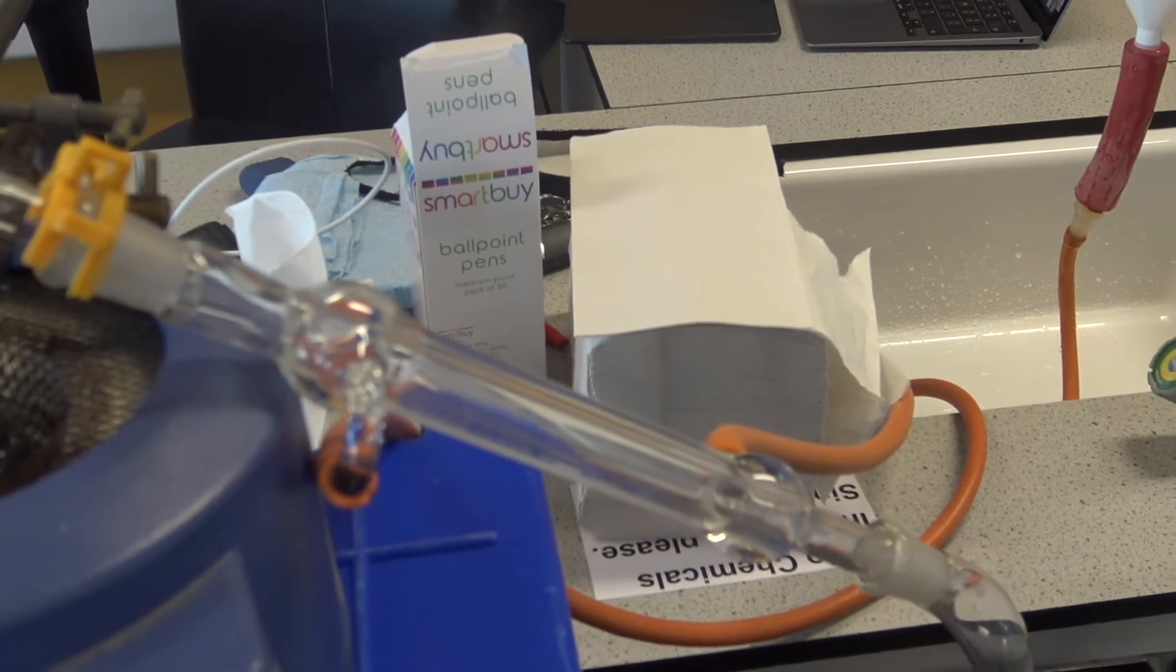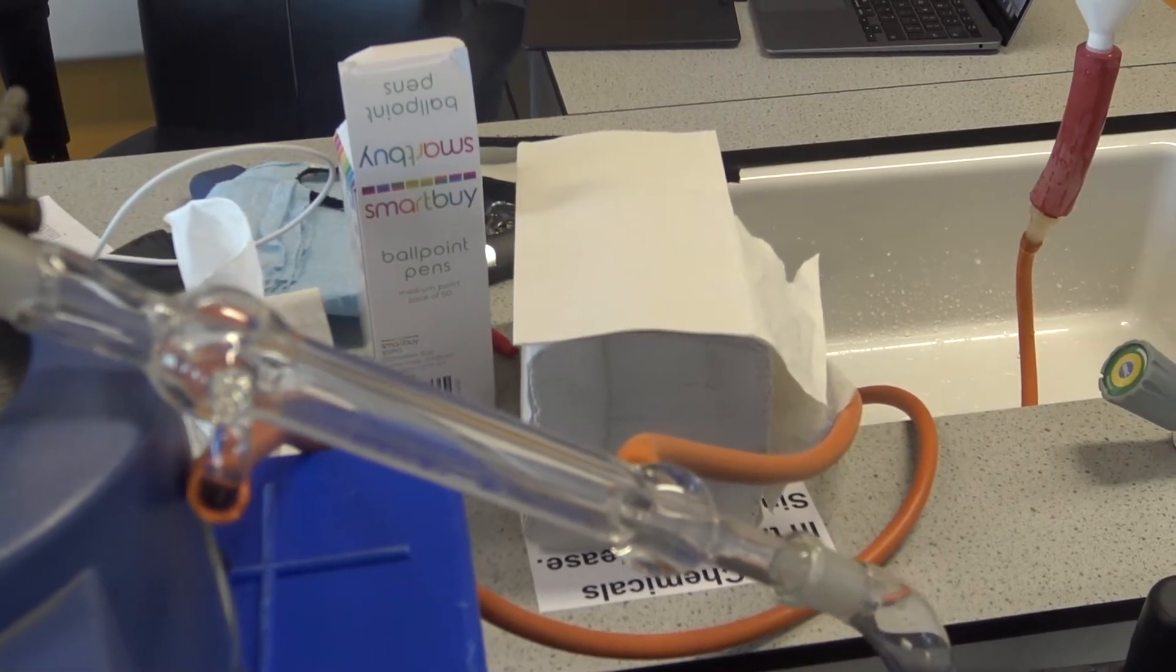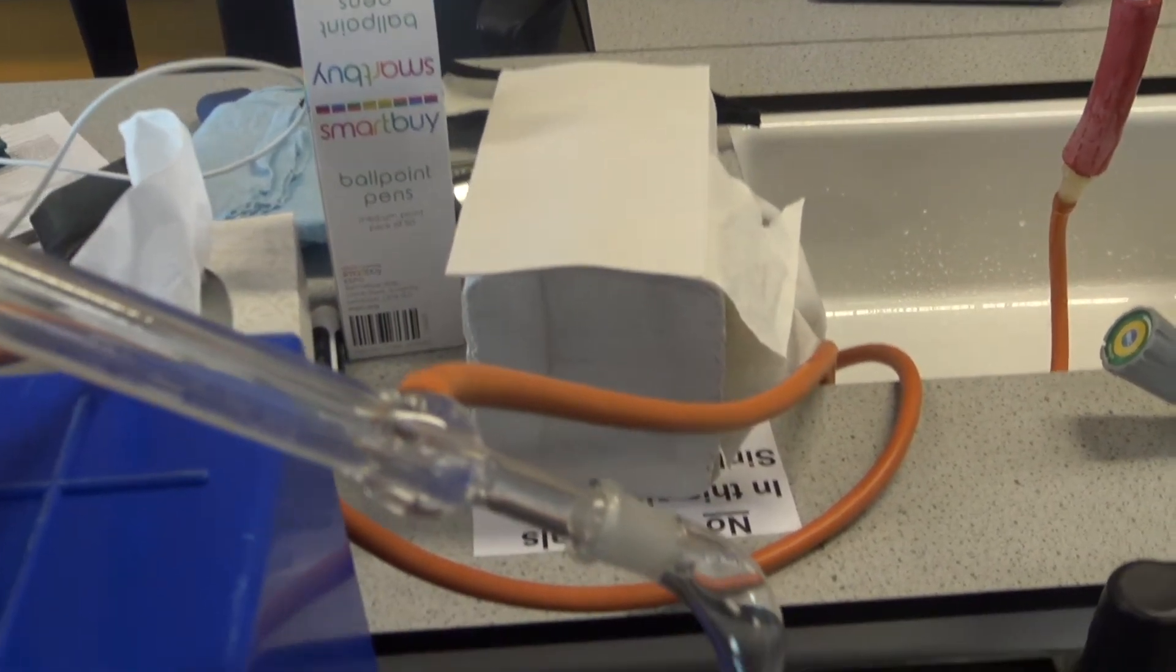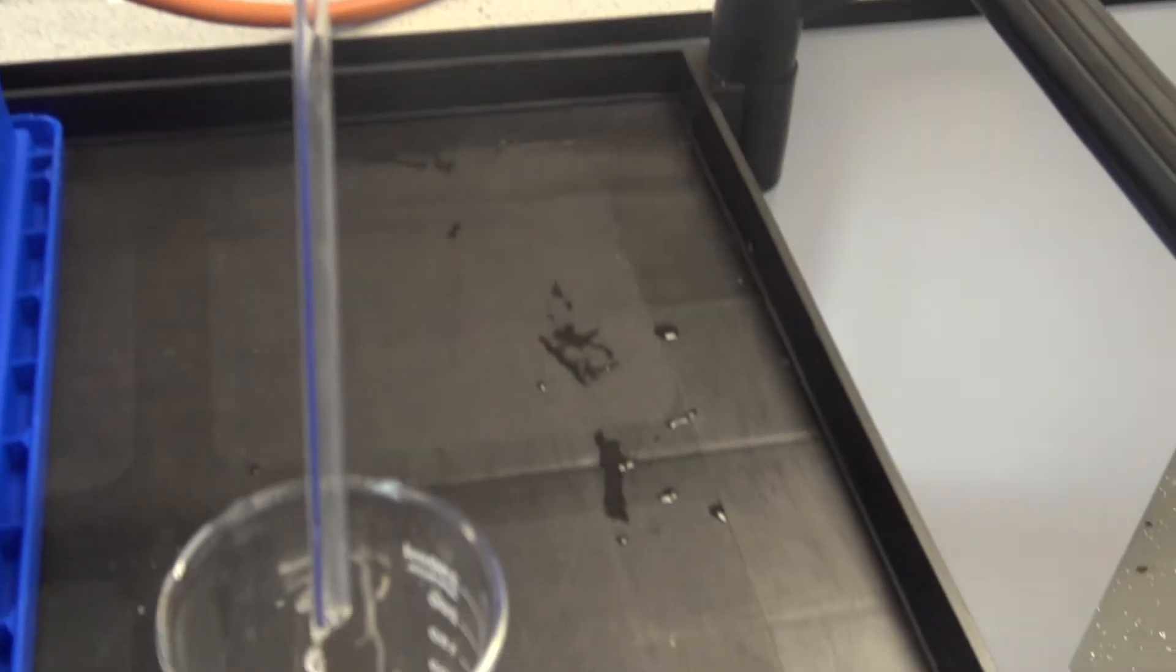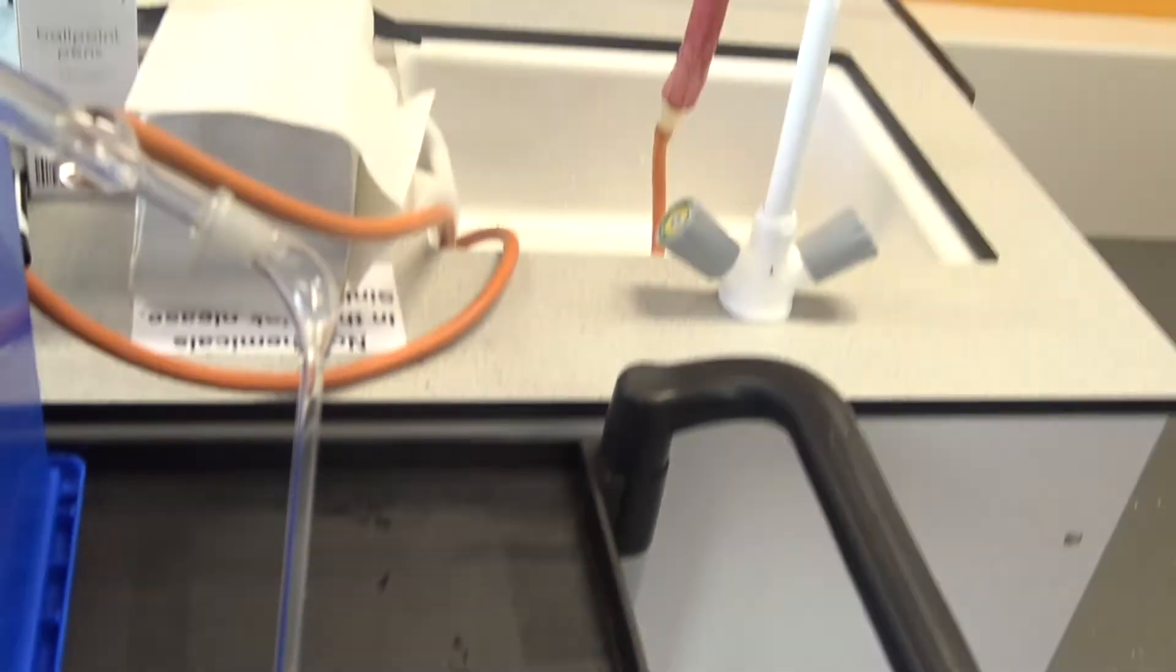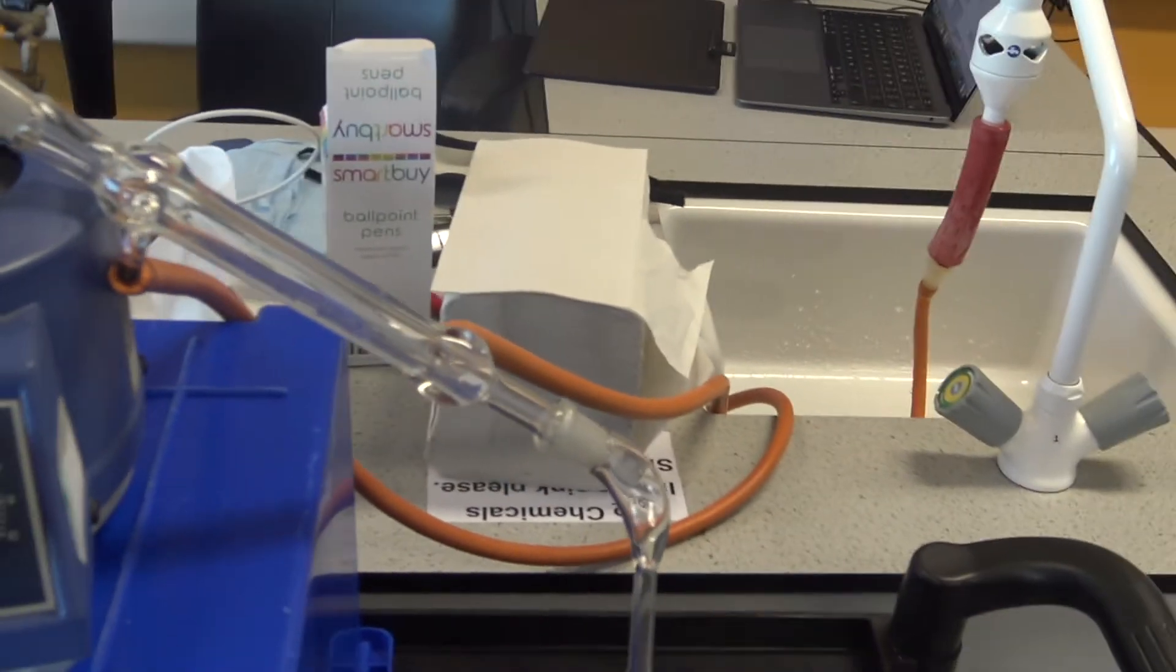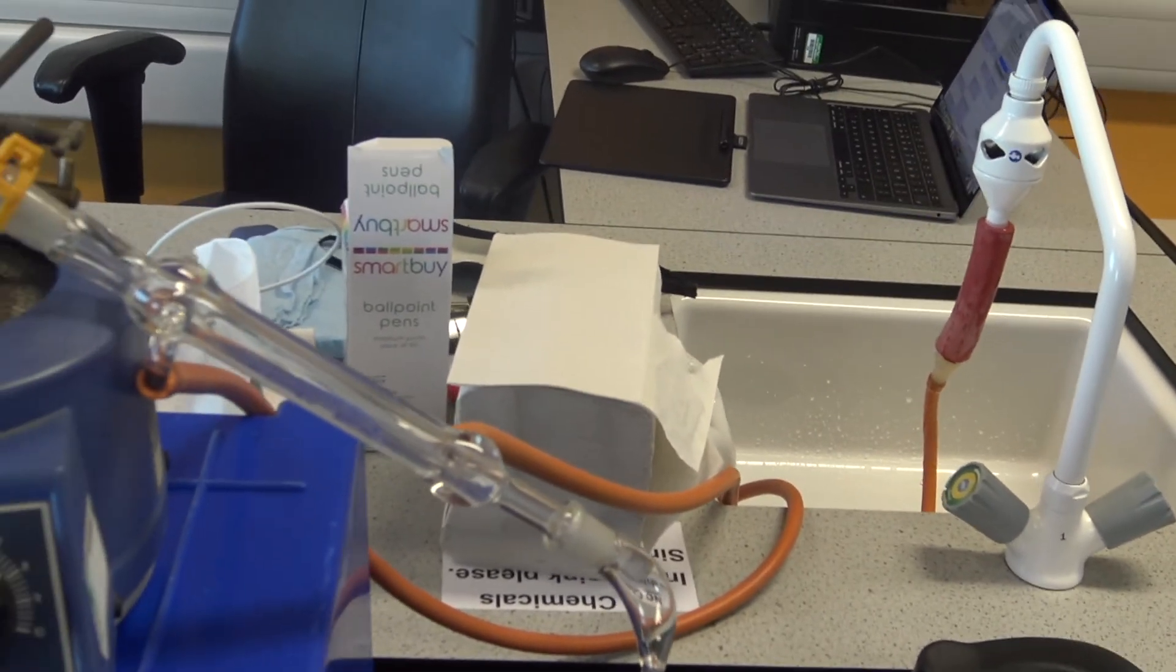The water that's been evaporated into a gas turns back into a liquid and condenses, and then we collect it down here in this beaker. We'll check back in about 10 to 15 minutes and see whether we've collected any water.